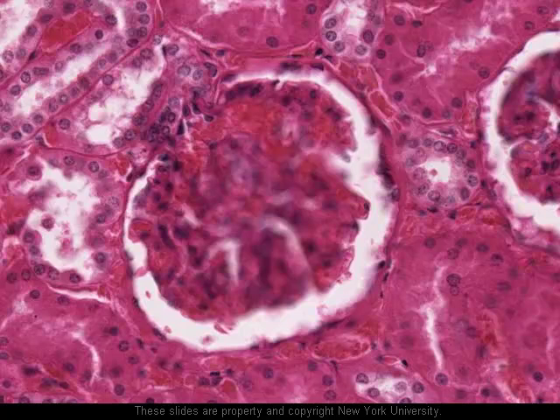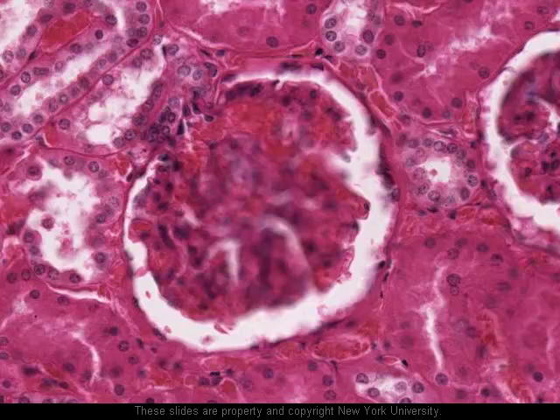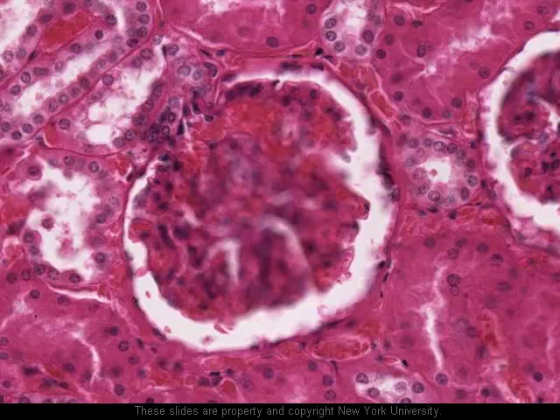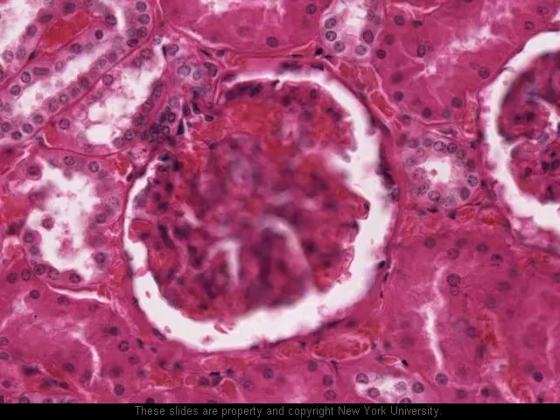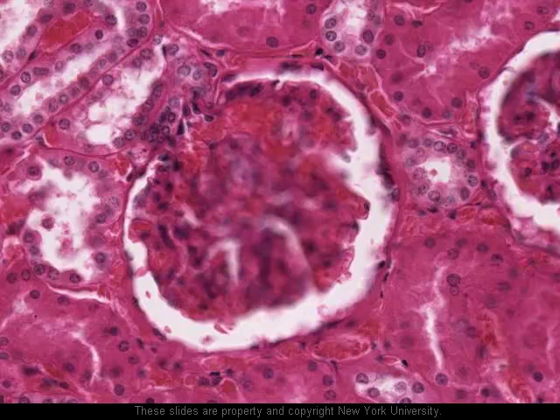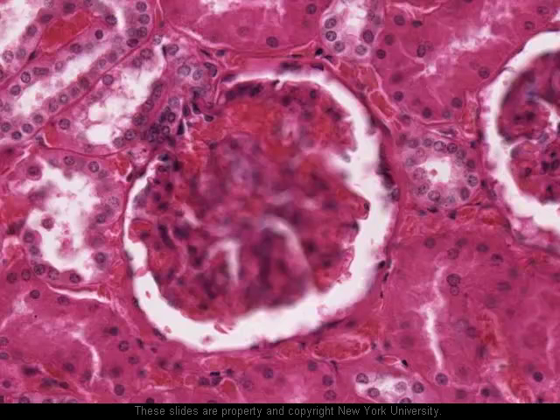Here's the distal convoluted tubule with the obvious-looking lumen as it passes by the vascular pole of the glomerulus. If we count the number of cells on one side of the tubule and then the other, it should be clear that here we see some cells in the distal convoluted tubule which are a bit smaller and more closely packed together, so we have a larger number of nuclei per unit area. These are the cells that form the macula densa. Here is where the afferent arteriole is, and these nuclei are the juxtaglomerular cells — the modified smooth muscle cells in the wall of the afferent arteriole. The entirety of this structure — macula densa, JG cells, and some associated cells — forms the juxtaglomerular apparatus.